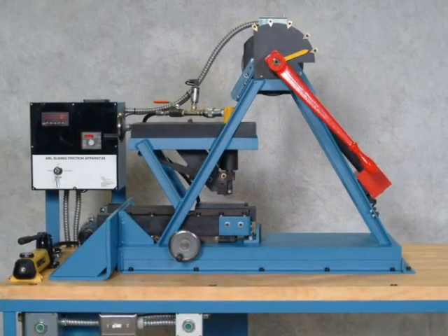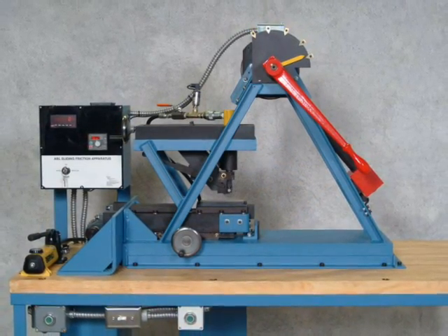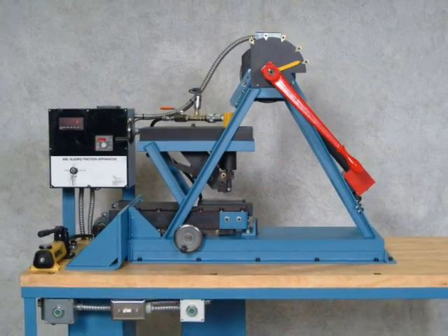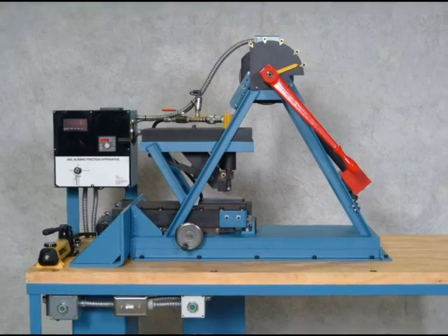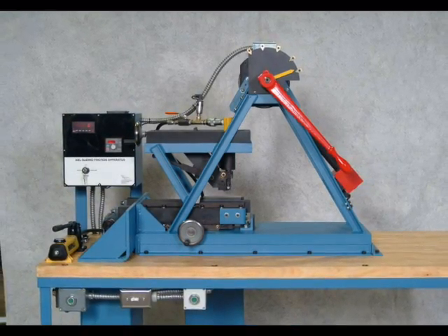The ABL friction test machine is a valuable asset to any company working with energetic materials that are subject to frictional forces.